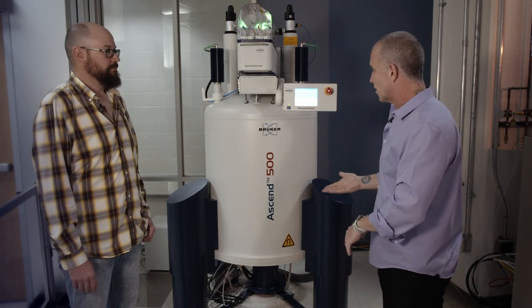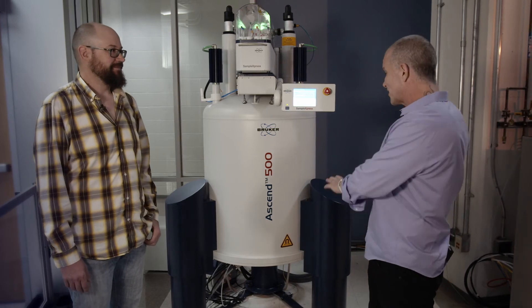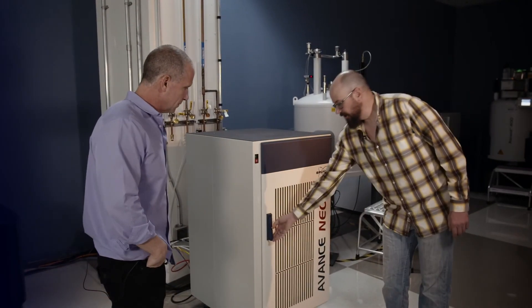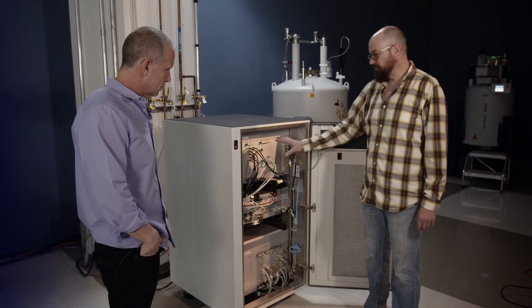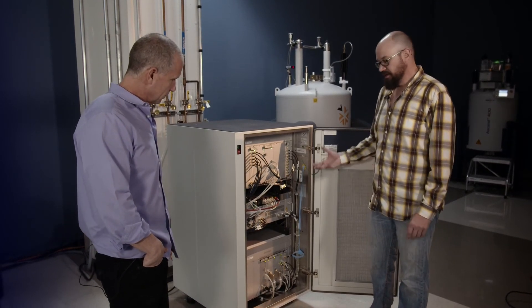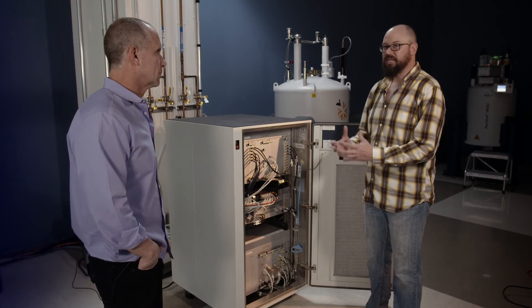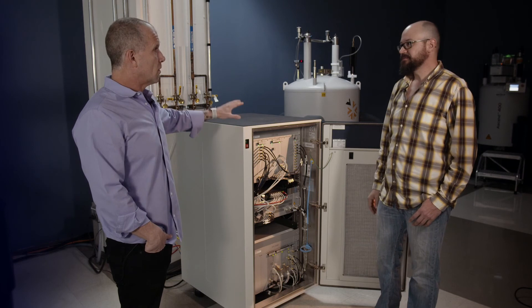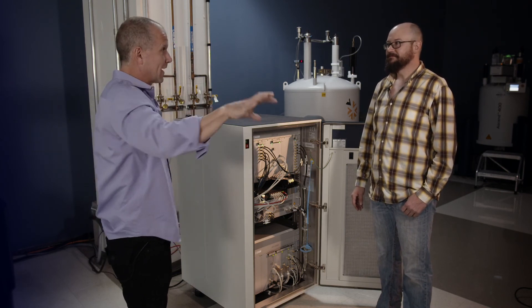The probe hooks up to another major component of the NMR — the console — usually separated from the magnet but not by much. Inside this big box is the console, or the brains of the magnet. At the top, the frequencies are generated and the pulse program runs — the brains of everything that drives the experiments. Next, there's an amplifier: we send out radio frequency waves that need to be amplified to a certain power level to flip the spin. At the bottom are the components that control the shimming, or homogeneity of the magnet. So inside here is essentially our radio station that connects to the probe — our antenna inside the magnet — to detect experiments, and it also connects to the computer, which is the other major interface a user starts from. This is really the connection between those two.